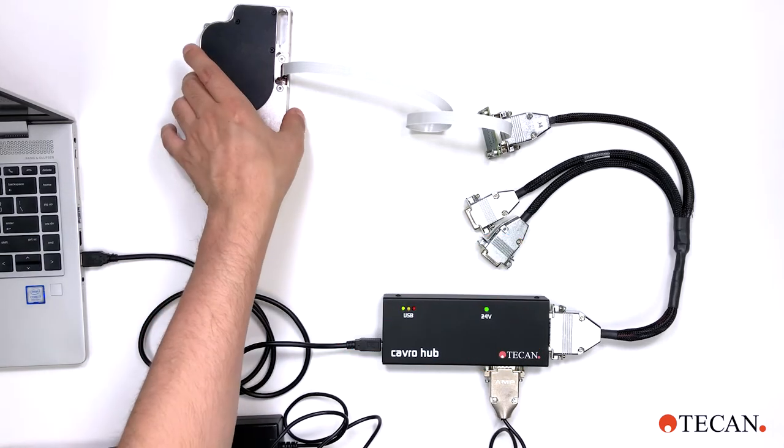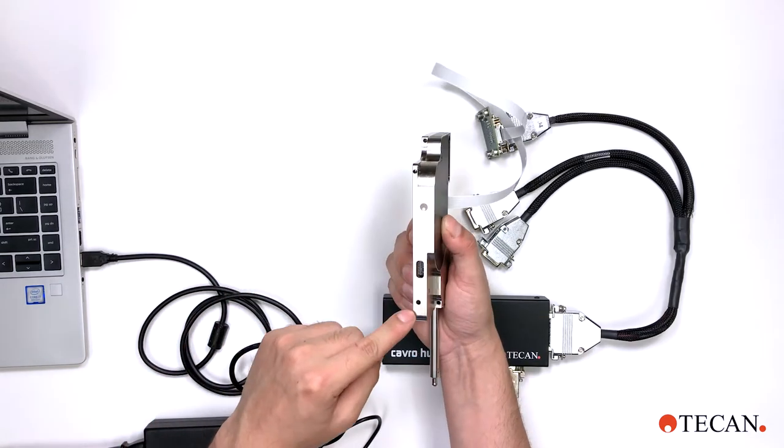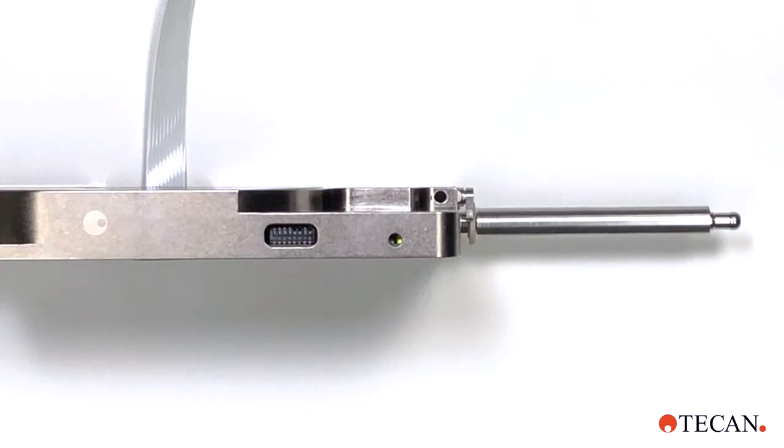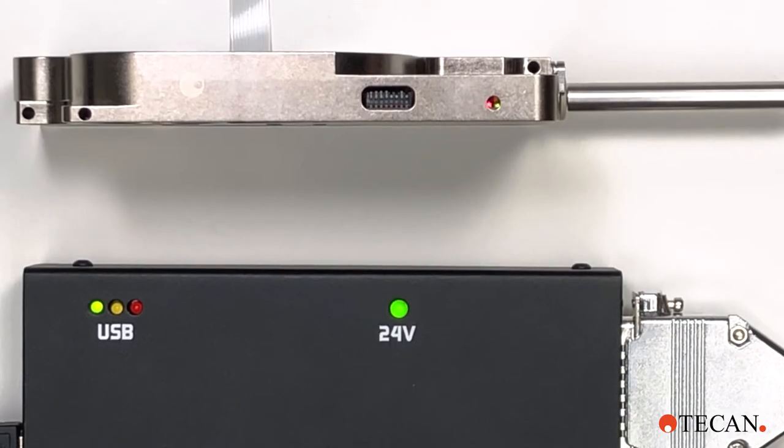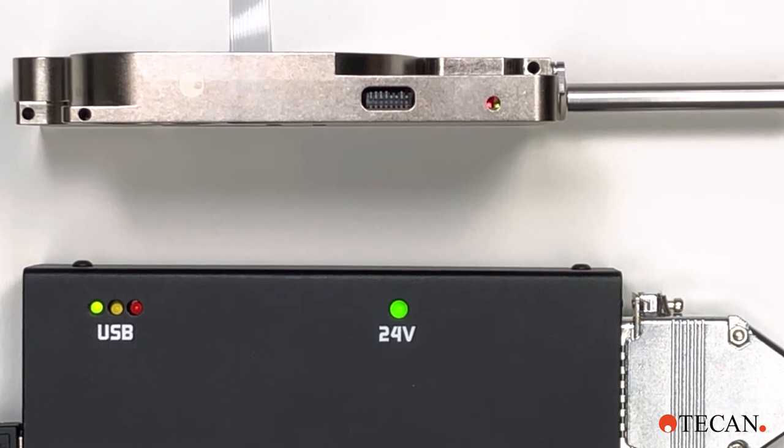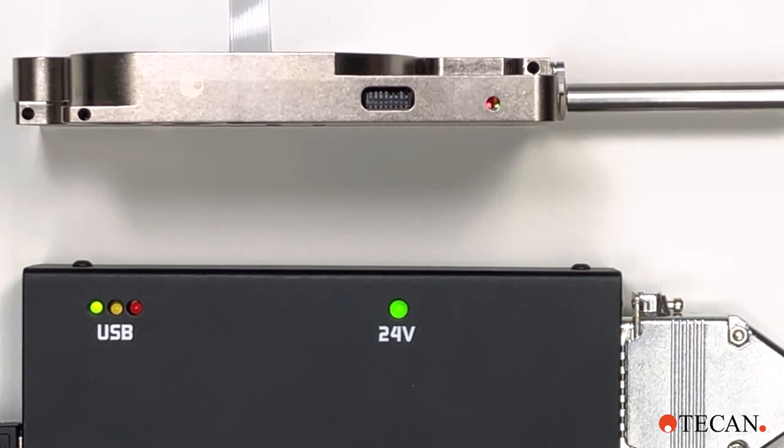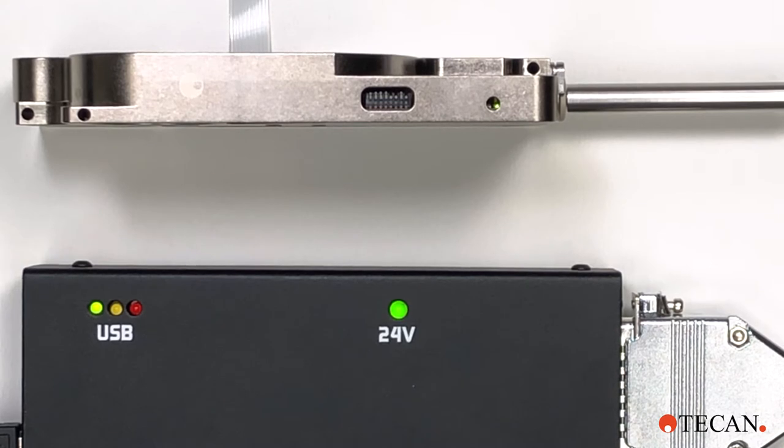Next, check the LED on the side of the ADP near the dip switches. The light provides device status. Flashing green with a brief flashing red indicates your ADP has power but has not yet been initialized. Flashing green indicates the ADP is initialized and ready for use.